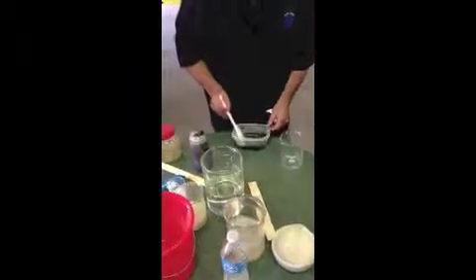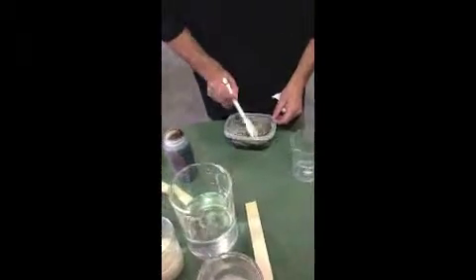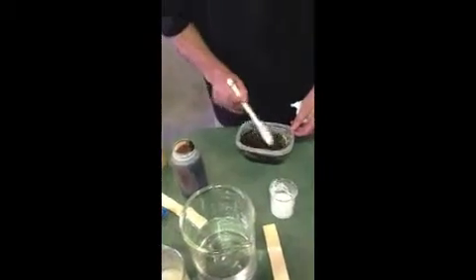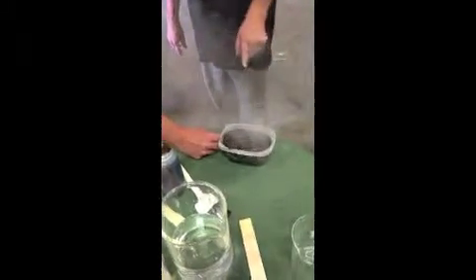It smells like cookies and cream. Looks like a nice cream. There it goes — that's a very exothermic reaction because it's boiling. The more toxic it is, the higher the temperature is going to go. So what about hydrochloric acid? No, this is oxygen. This is pure oxygen? It converts to oxygen. Right now it's doing its thing. You saw how very little of it I put in.